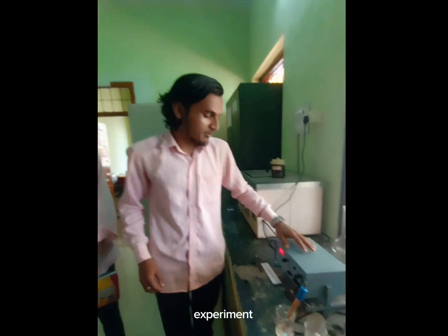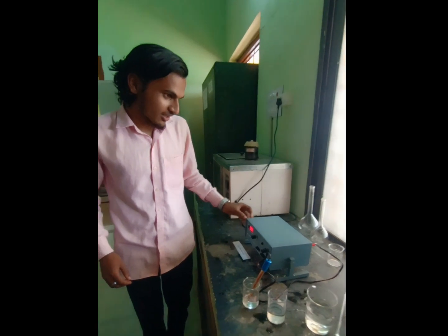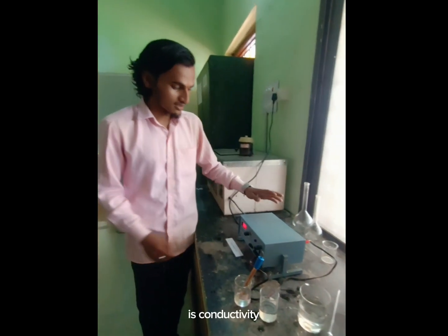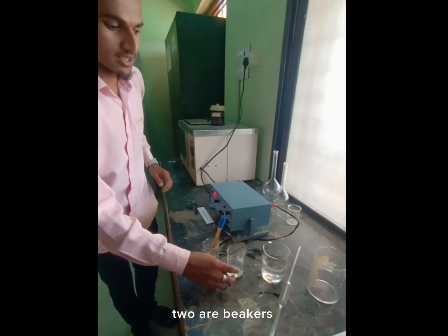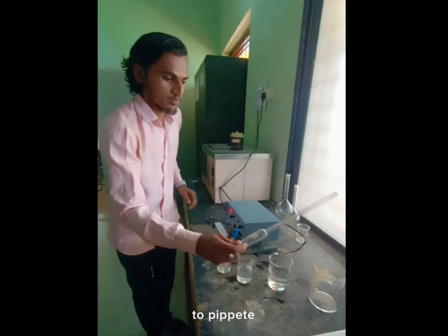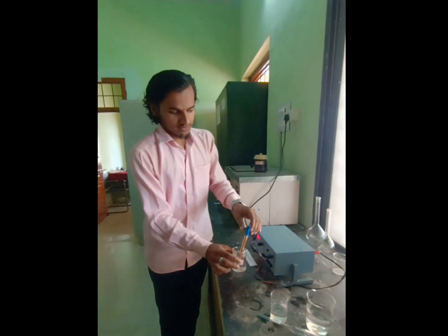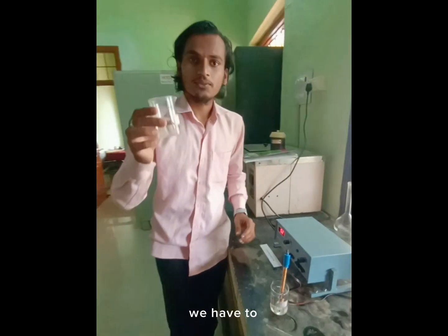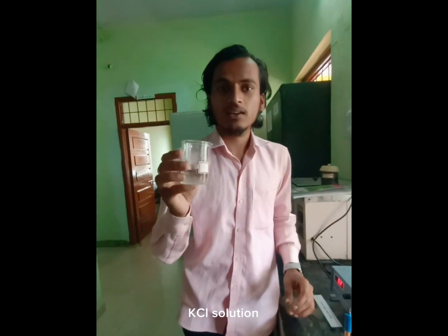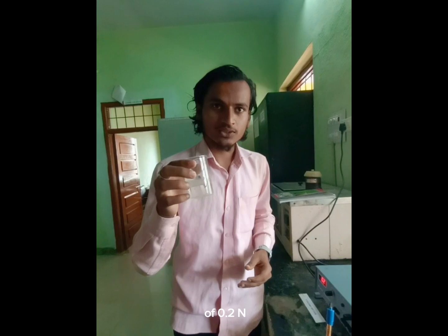Today we are conducting an experiment: determination of equivalent conductance at infinite dilution of a strong electrolyte using KCl. This is the conductivity bridge, this is the conductivity cell, and these two are beakers. We also require a pipette and distilled water and KCl solution. We have to take 50 ml of KCl solution in a 100 ml beaker of normality 0.2.